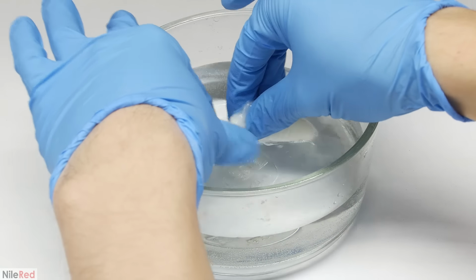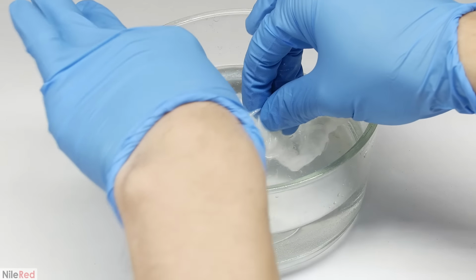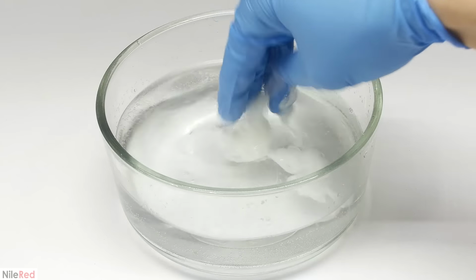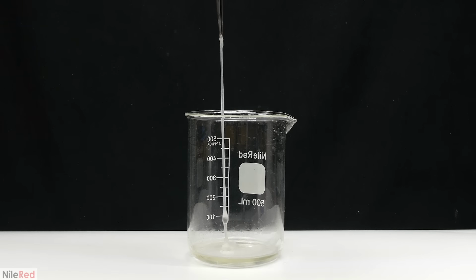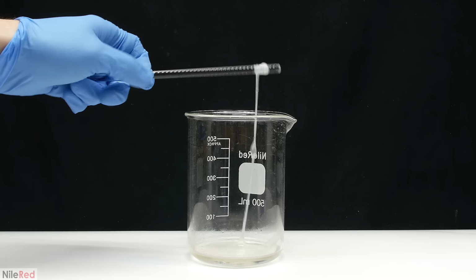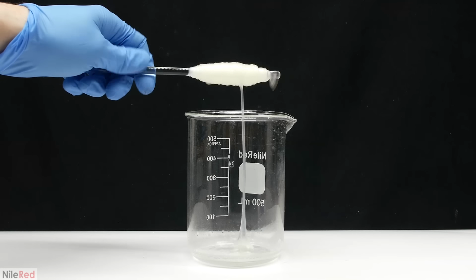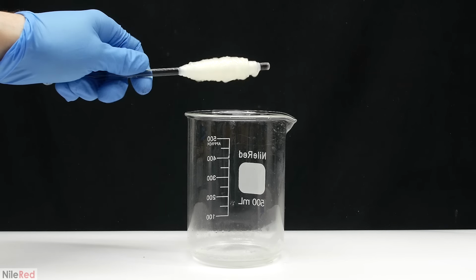Without destroying the nylon, I manually pull it apart to try to give it a better washing. After about 30 seconds, I just leave it there to soak, and I move on to making more nylon. I tried it again using the same amount of each ingredient, but this time in a much larger beaker. It ended up being pretty much the same thing, and the only difference was that it was a little bit faster. There's a larger surface area between the two layers, so we pull more nylon with each turn.